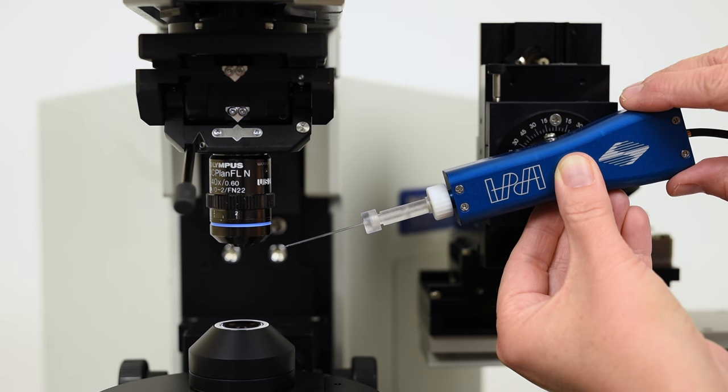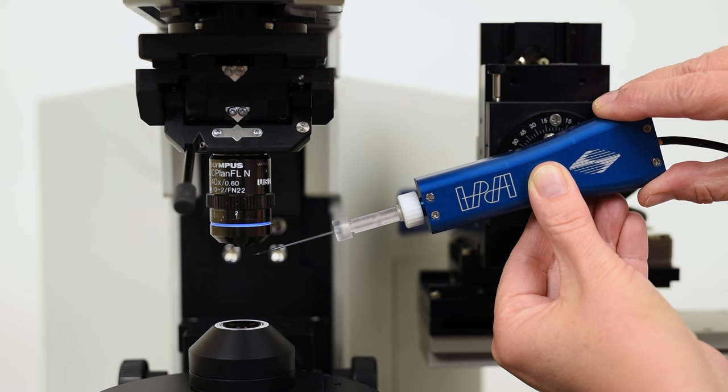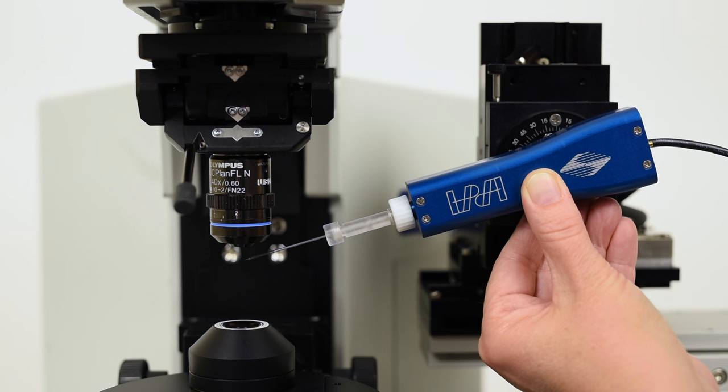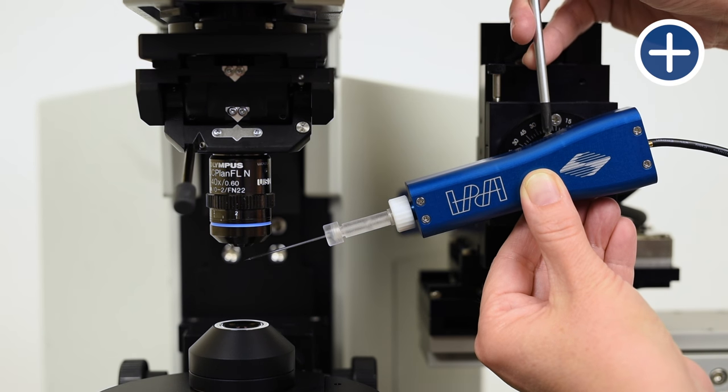A second option would be to clamp the head stage further down on its dovetail. While this will give you better reach, it is less desirable and will cause more instability in your setup.